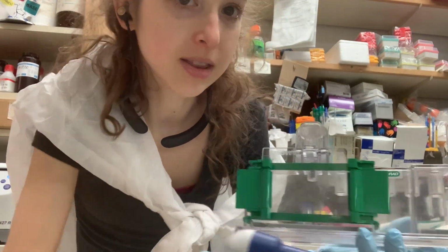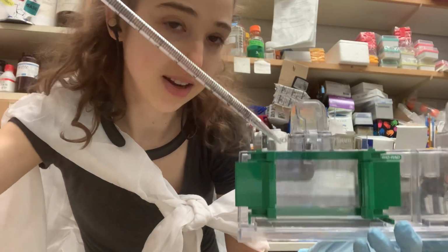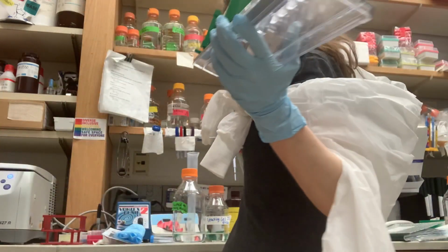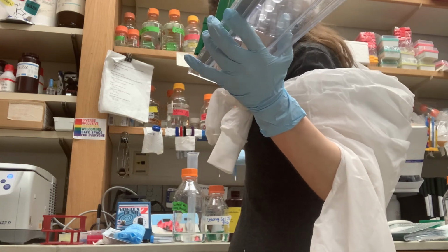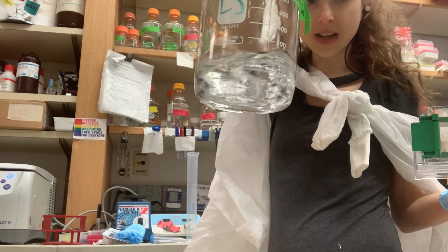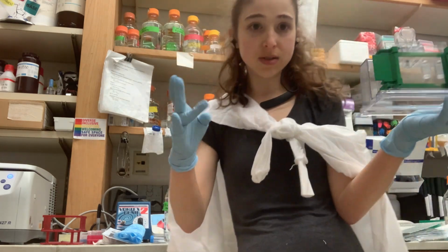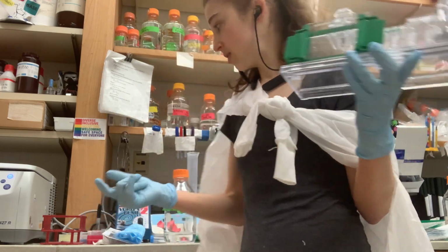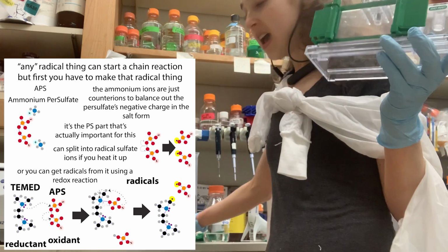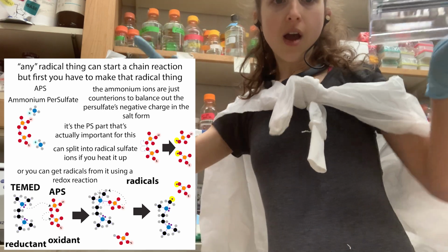when you pour in the stuff, you can just pipette it from the corner slowly, or else it'll overflow. You don't want that. At this point it's all liquidy. It's not going to polymerize on its own. We have to make it polymerize, and how we do that is we use an oxidizing agent. So we use a solution of APS, ammonium persulfate, and then in the hood we have TEMED, T-E-M-E-D.